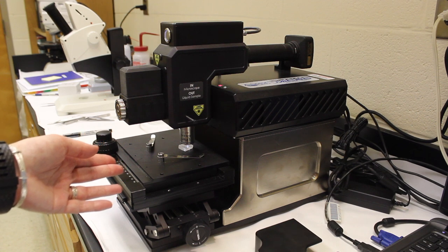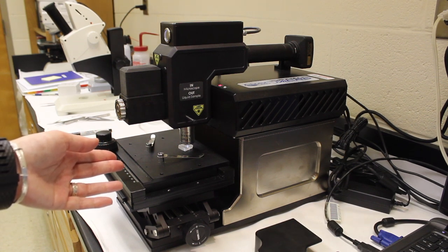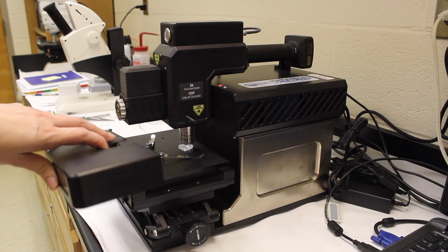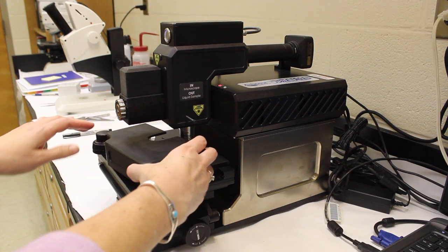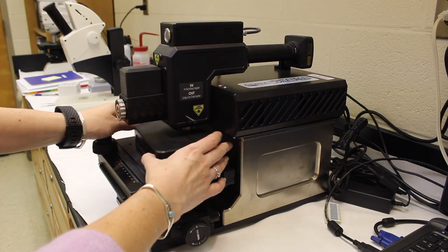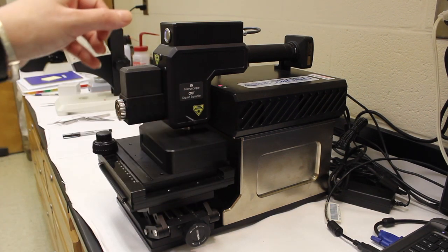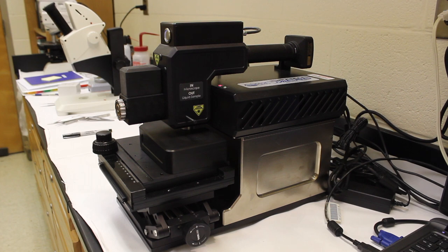When we have found a nice flat surface and focused on the top of it, we want to put the cover over the sample to protect it because the overhead lights will produce fluorescence in the spectrum, and we don't want that. It also protects our eyes from the laser.